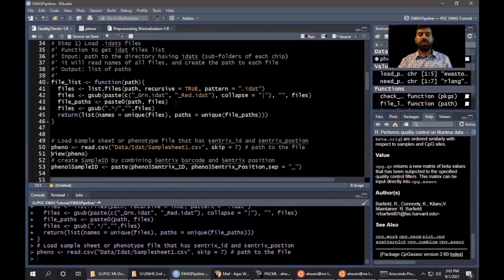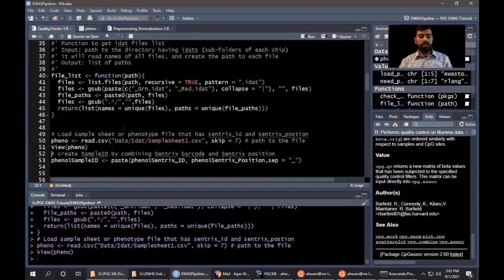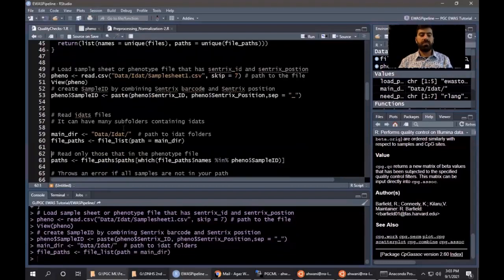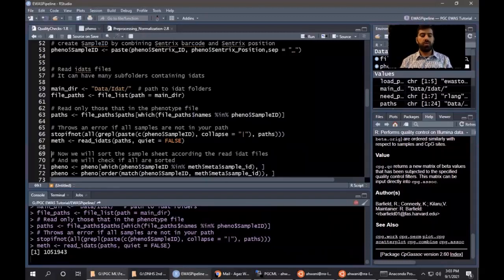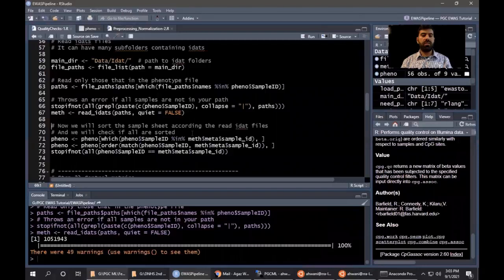We also have a sample sheet that comes with the raw data that looks something like this, where we have Sentrix ID and Sentrix position. We have the sample name. So we need to use this sample sheet to read the IDAT files. So we are reading the IDAT files. It will take a few seconds. We are almost done reading the IDAT files.